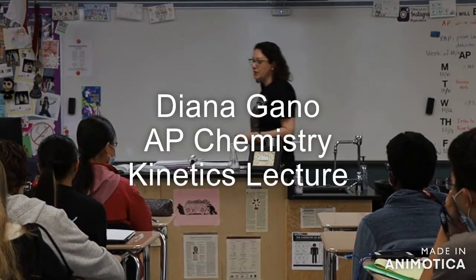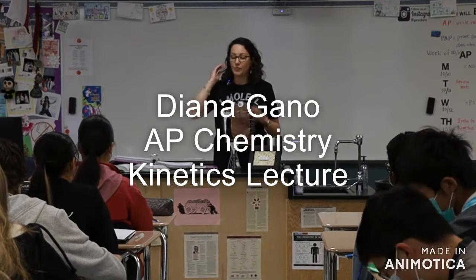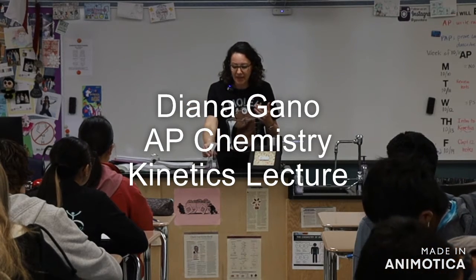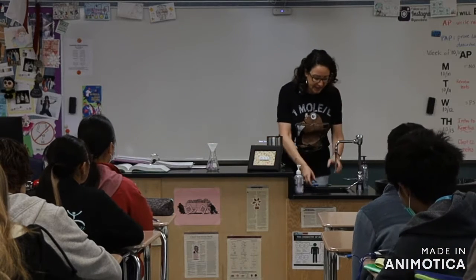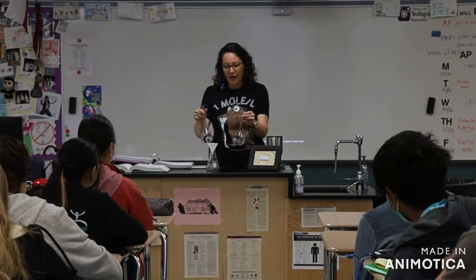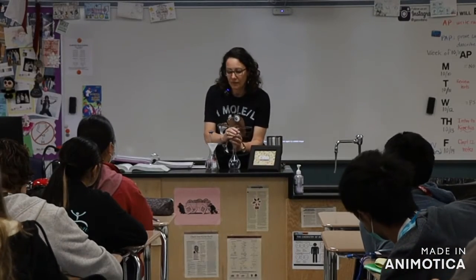So we have a new unit of kinetics that we're starting here, and yesterday you guys read a little bit, or listened a little bit, about kinetics and rate laws. So I wanted to do a demo for you, a kinetics demo. So I have two colorless solutions here, solution A and solution B, that we're going to mix.